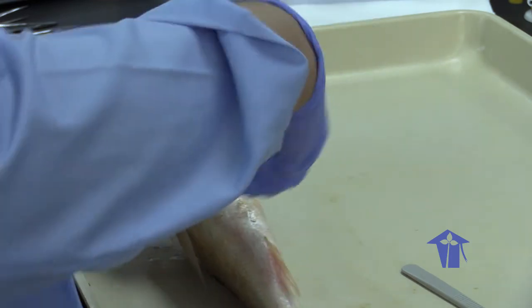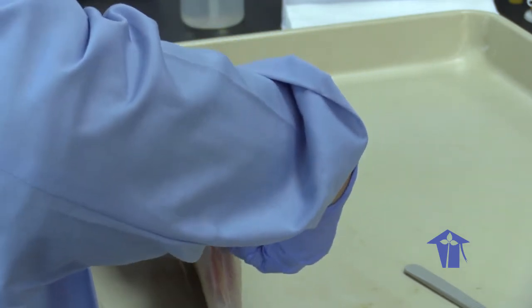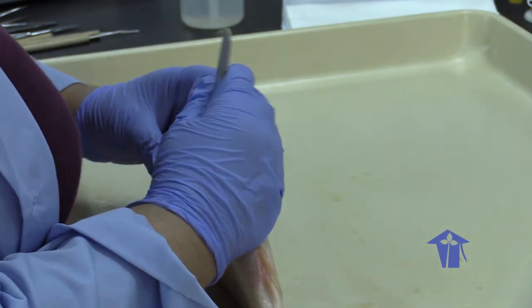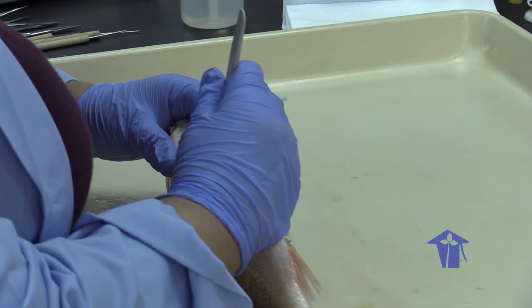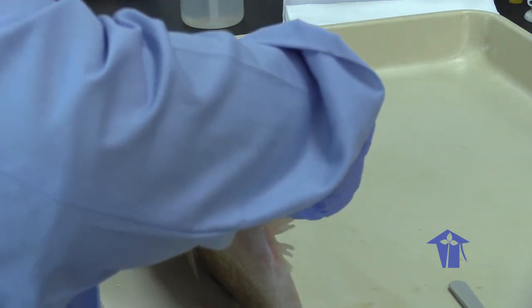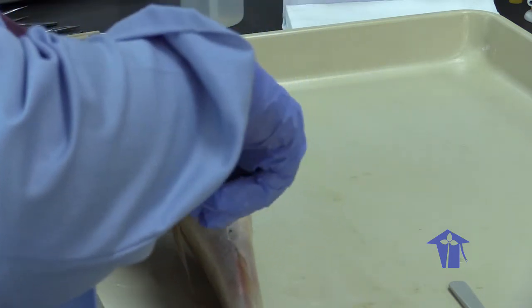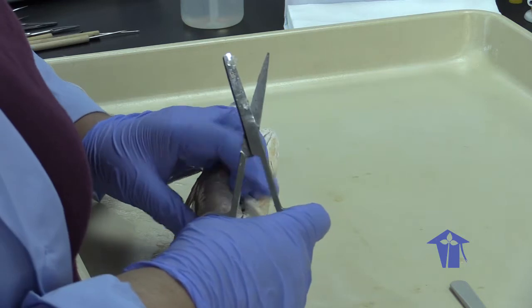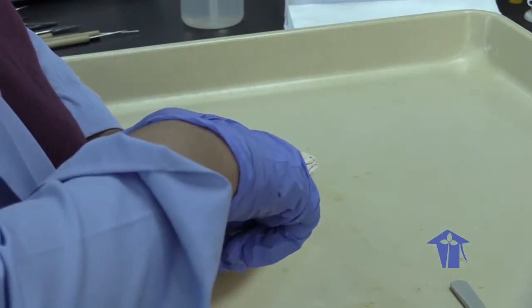Right. So I'm here at the pelvic girdle now. And it's going to take a little work to get through this, because I'm actually going to have to be cutting through bone here. This is a little hard with the scissors. And I want to do this without cutting myself. Because nobody wants to see that happen. That was just cutting through the flesh. Just get the bone. Ouch, that hurts. Right, so I got through the bone. Cutting up now. Right. So at this point, I'm going to cut to display the visceral cavity of this fish.